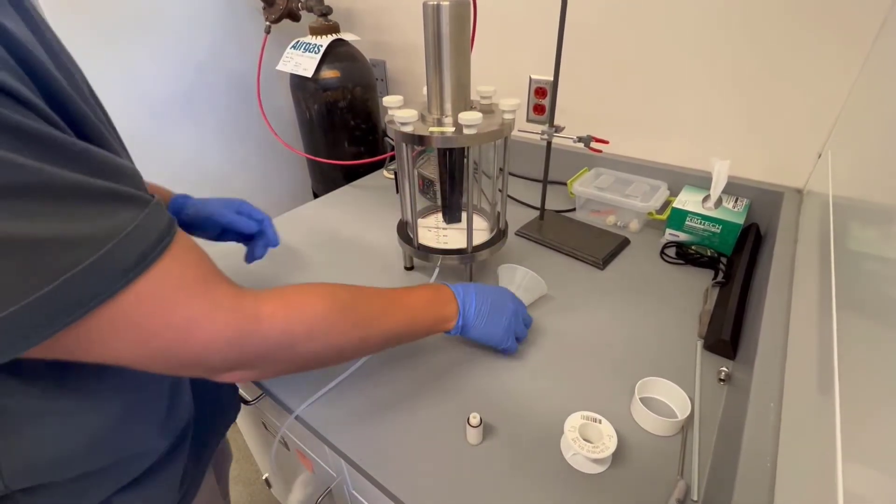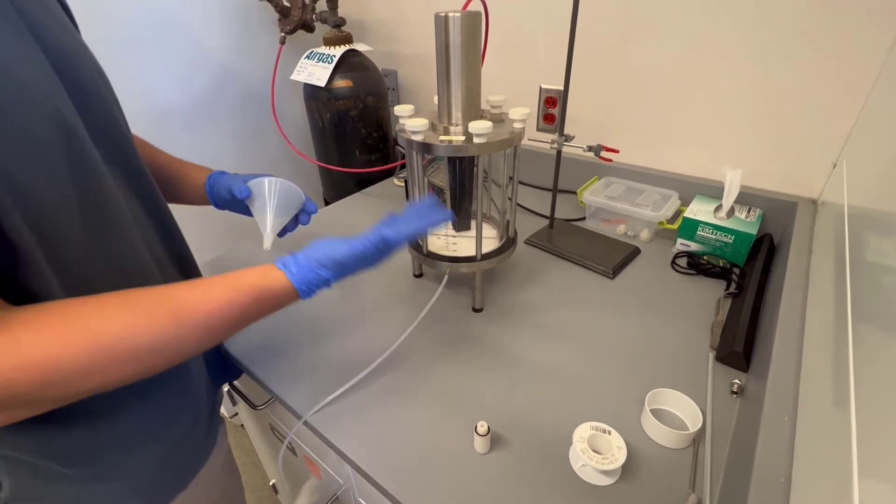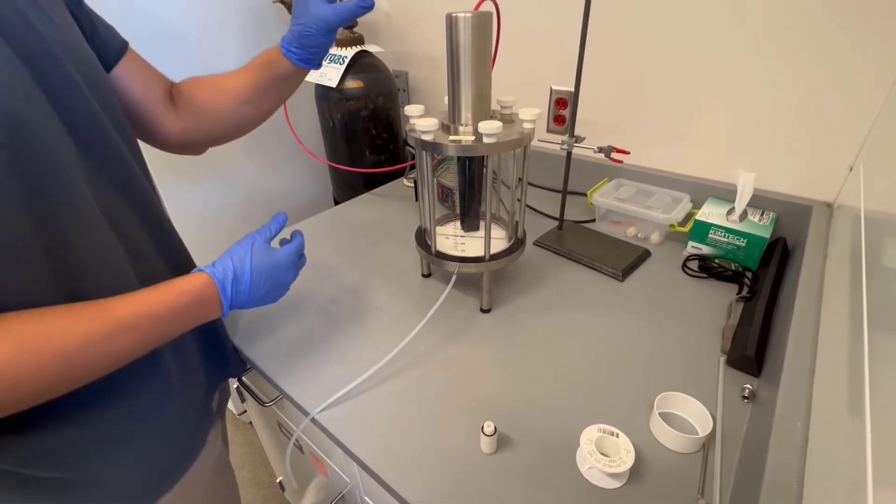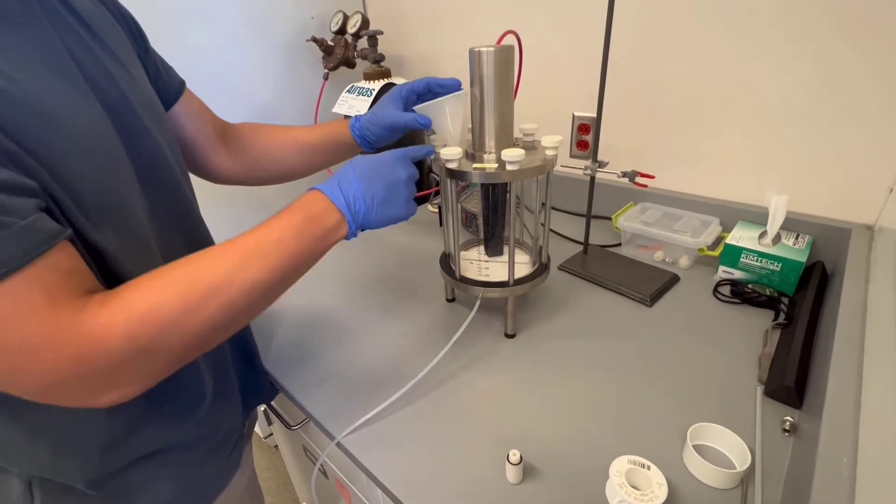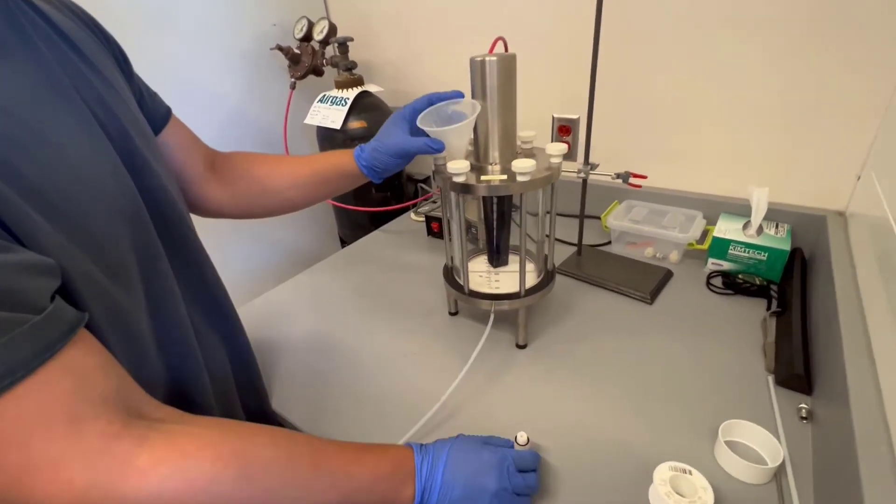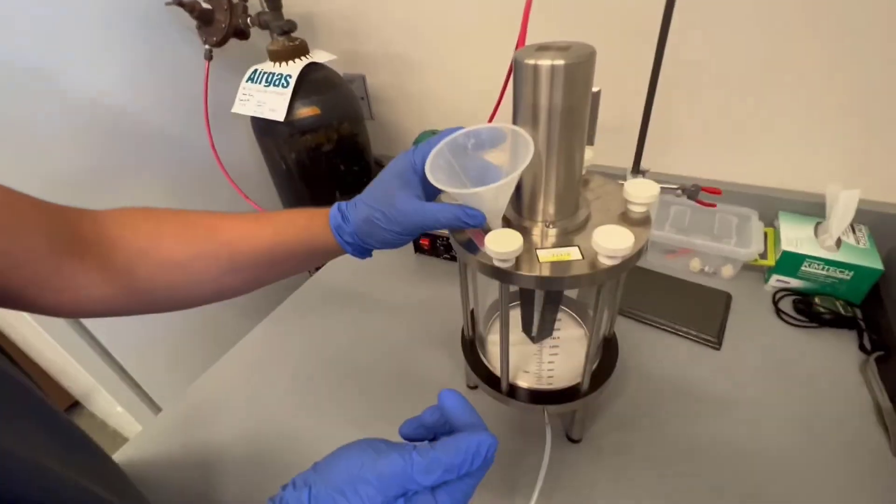Now in the process, you're going to want to add your water or protein solution wherever you are in your steps, and you're going to use a funnel and use the hole where the gas stopper will go into, and you're going to add your solution into there.